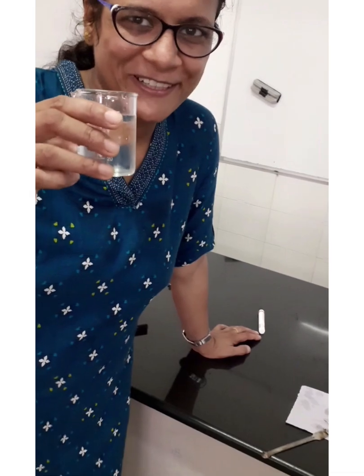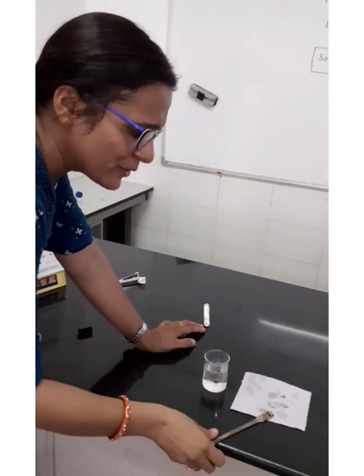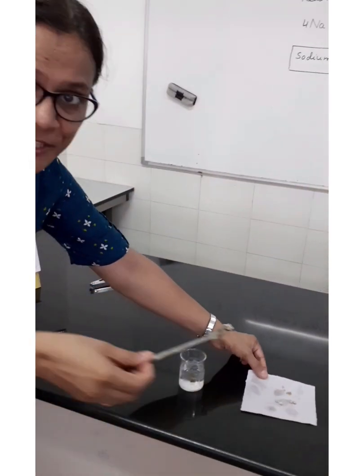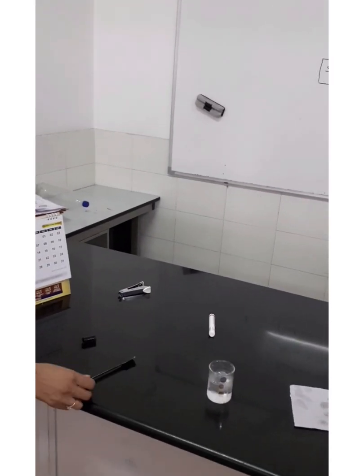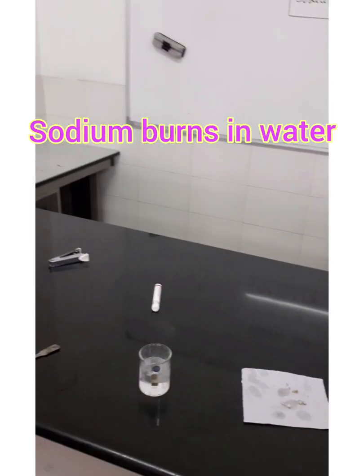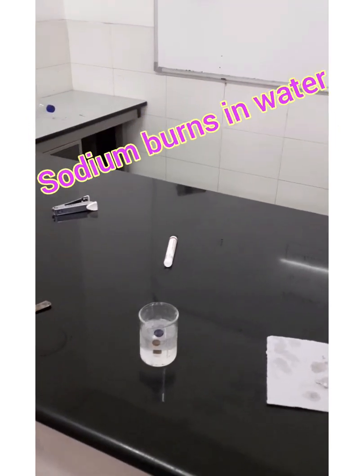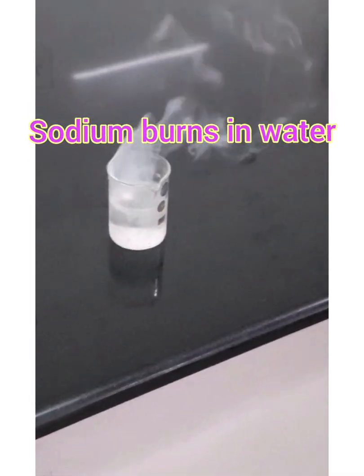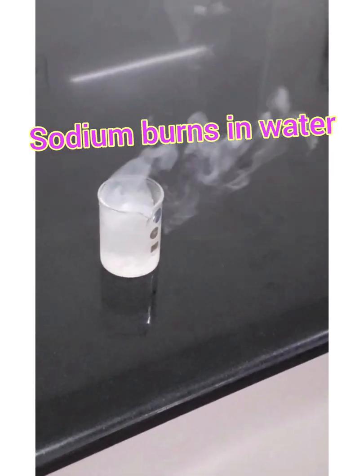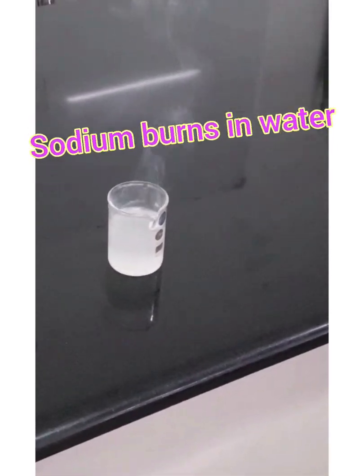I have some water and now I am going to put this sodium metal into the water and observe the change. You can see that it has started catching fire, and smoke has started coming out.